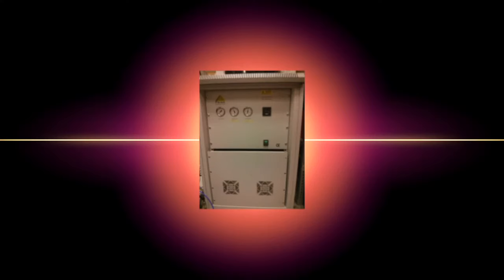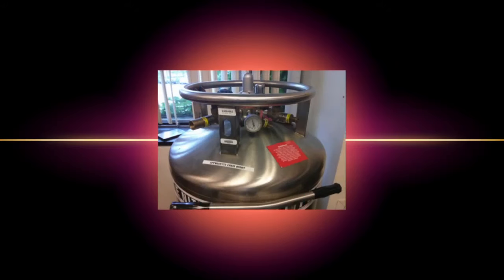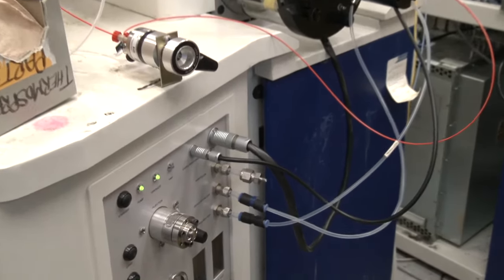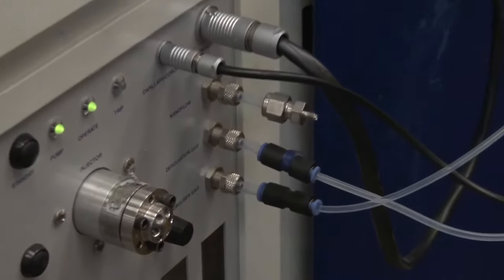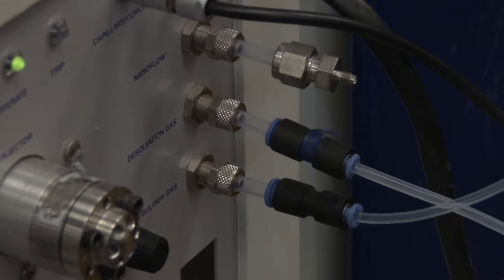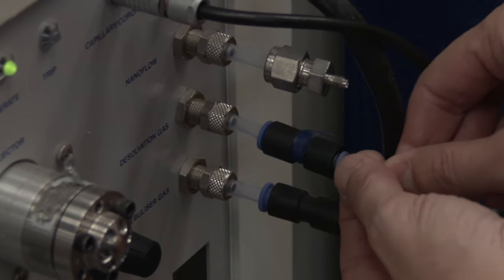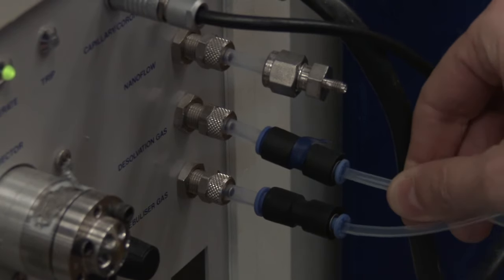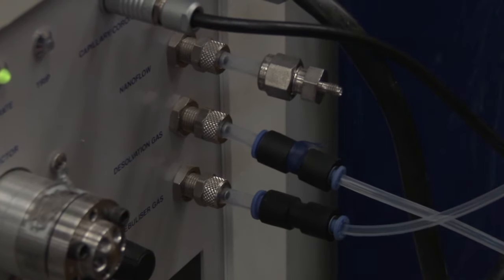Gases to the instruments can also be supplied by a nitrogen generator or one of these large liquid nitrogen containers. Most modern mass spectrometers possess these push-and-pull connectors on the high-pressure gas lines. They can be removed when the gas is off by pushing the blue end piece towards the back towards the black center piece while simultaneously pulling the tubing out in the opposite direction.